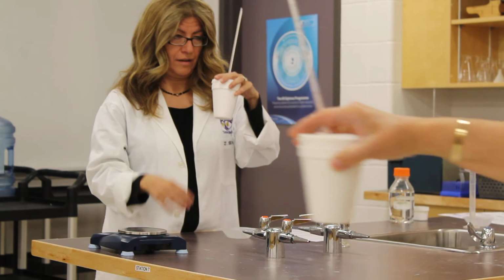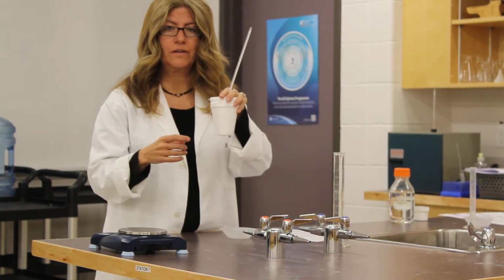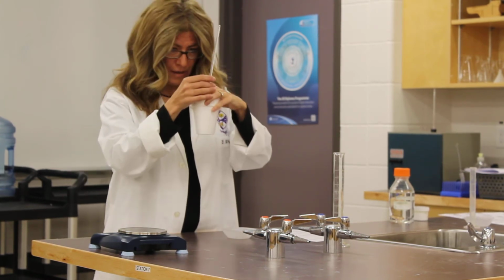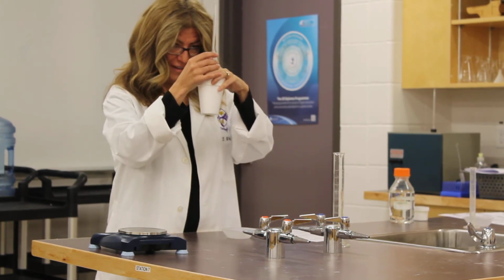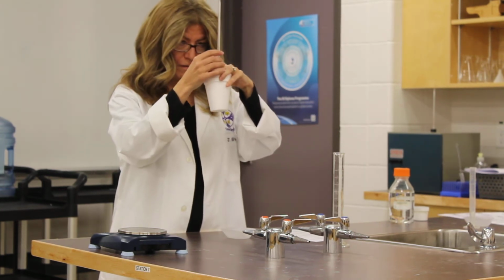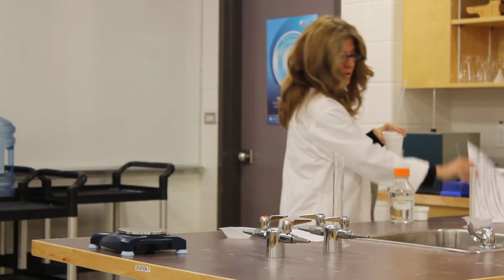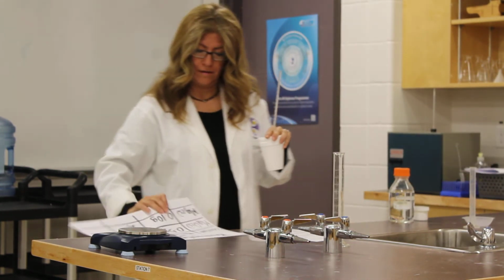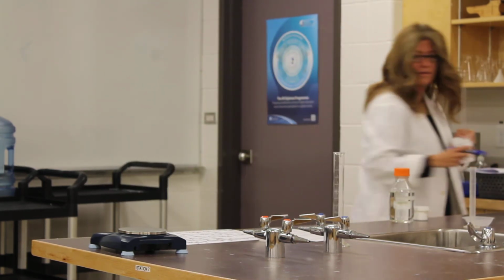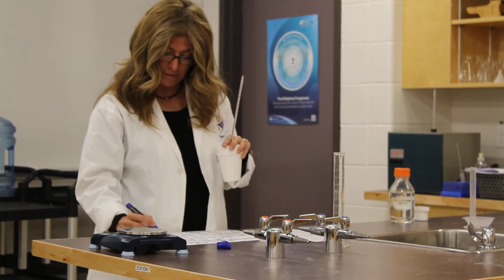And what happens is you just watch for the temperature change until it stops changing, obviously. That one's been between 31 and 32 for a while. Okay, so I think we're done. This one's done, probably 31.5. Yeah, that's what I was guessing. Yes, 31.5. So I'm going to write it down, and this is the magnesium oxide.